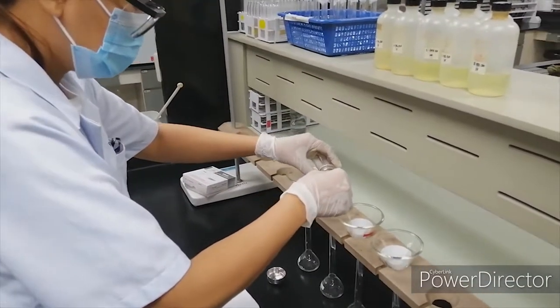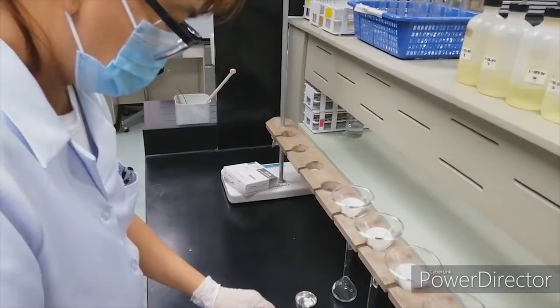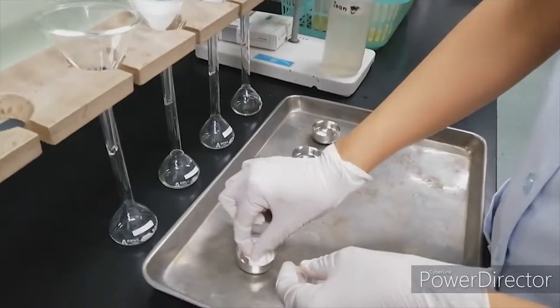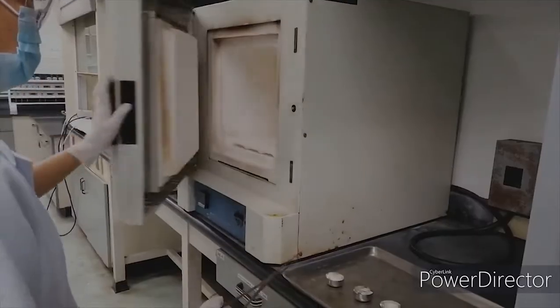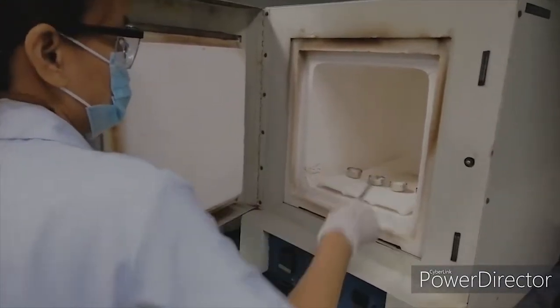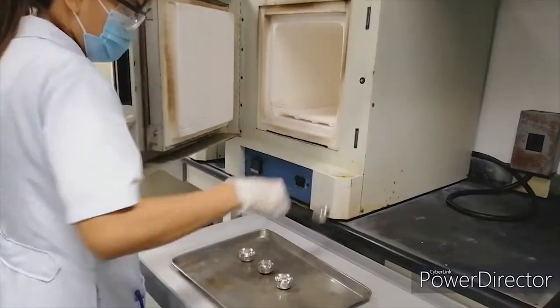The samples are digested by ashing and filtering, and if needed, especially for micronutrients and heavy metals determination, the plant samples are digested by double calcination. The samples are digested with hydrofluoric acid using platinum dishes to remove the high amounts of silica in leaves, especially coconut leaves.